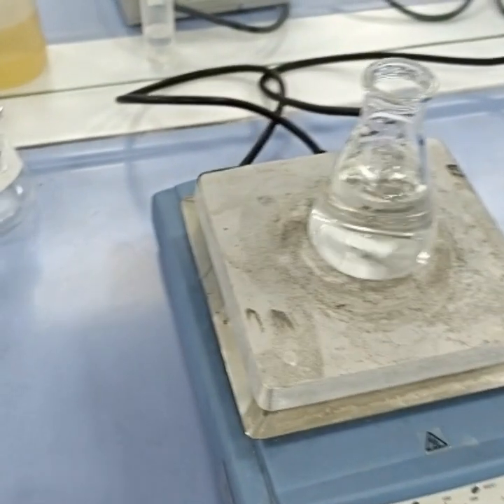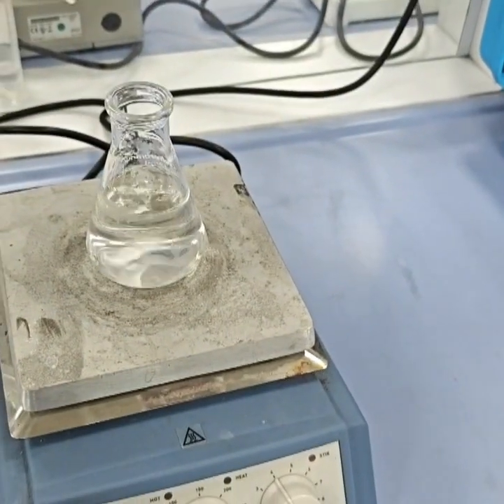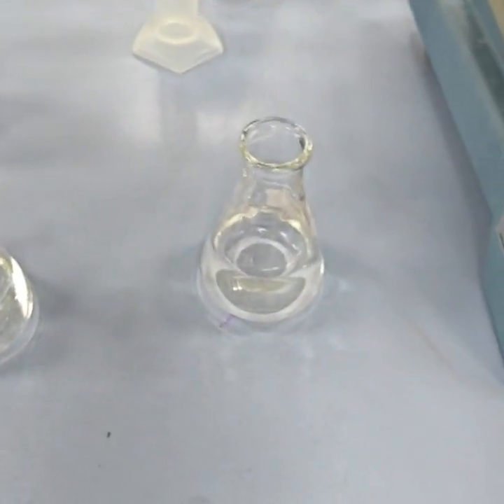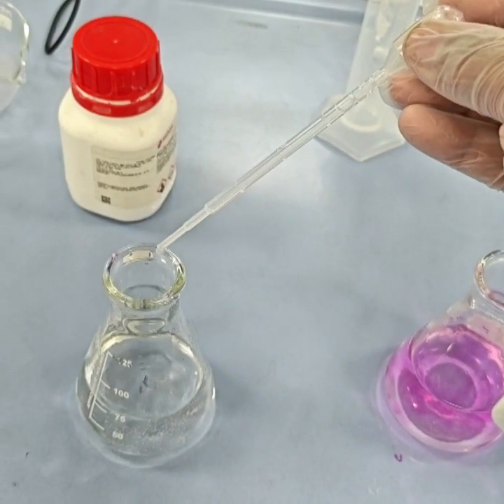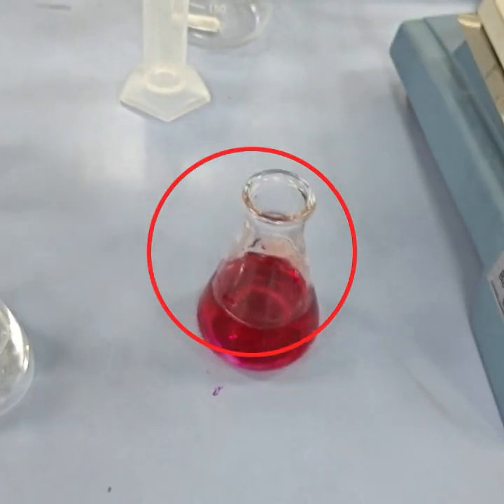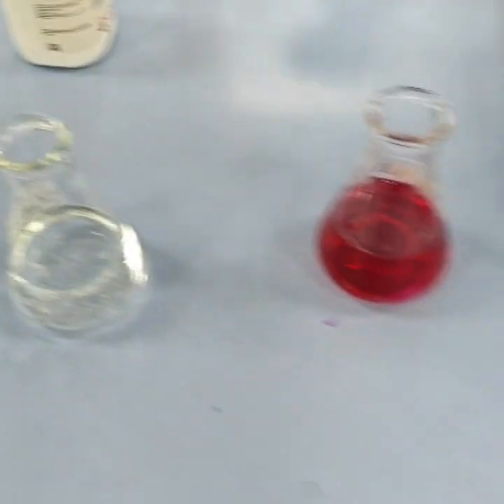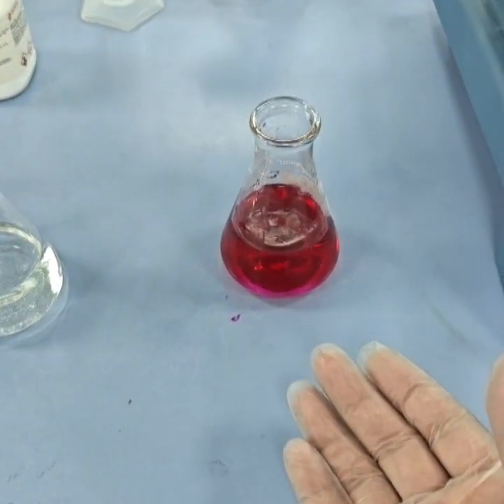Now, how do we check whether our freshly prepared indicator solution is working well or not? We have a test to do that. I have a clean pipette, so I will pour some of it into the solutions. Here we have two water solutions: one is alkaline and the other is not alkaline. You can see it does not give a color in one and it gives a strong color in the other. So this is the test to check whether your phenolphthalein indicator is working fine or not. If we have an old prepared solution, it may give a low tinge or low color, and if it is freshly prepared, it gives a high tinge or a high color.